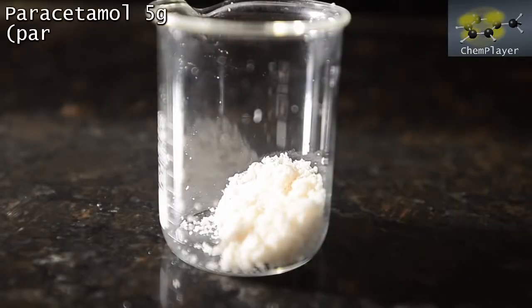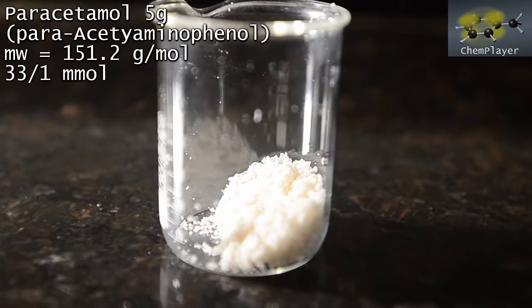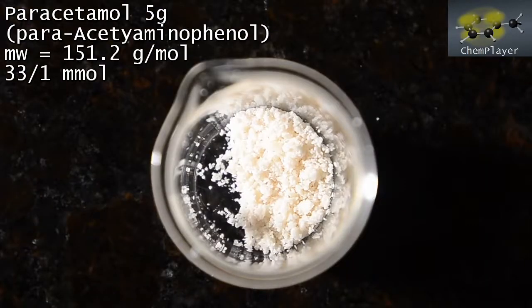Here we've got 5 grams of paracetamol which we previously extracted from analgesic tablets and recrystallized. It's been in storage for a little while and it's got a very faint pink color, but it should still be quite pure.